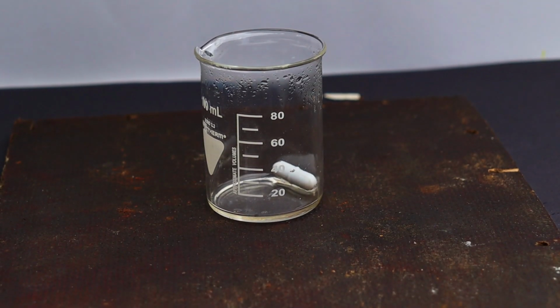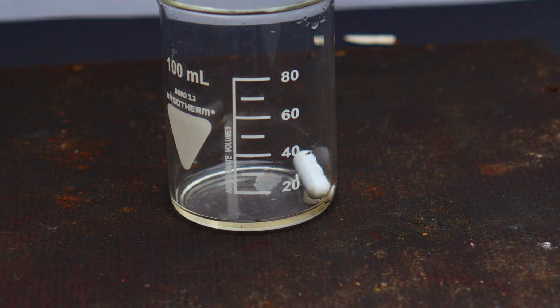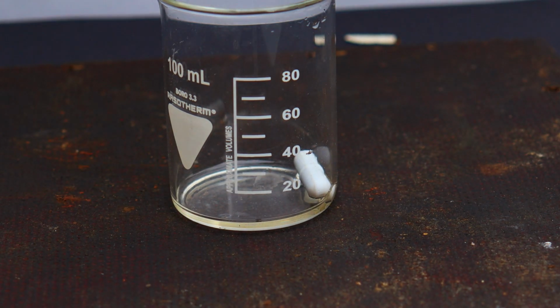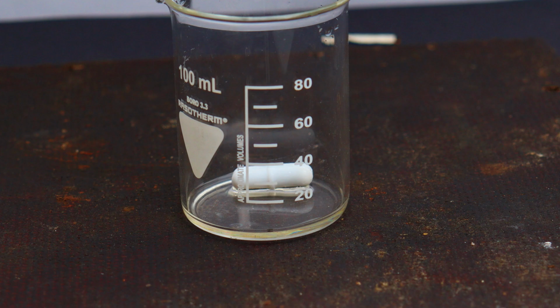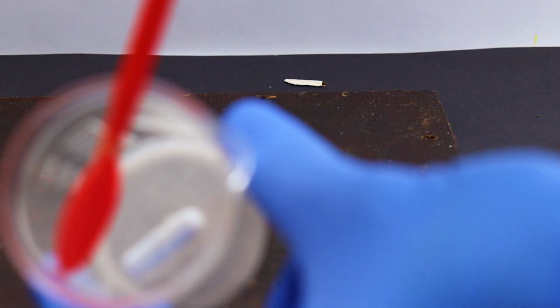I wanted to record an epic crystallization, but apparently it stopped making crystals for some reason. Maybe the zinc chloride was pulling water from the air and redissolving. I don't know. Anyhow, this is our zinc chloride. I didn't need much, so this was enough.